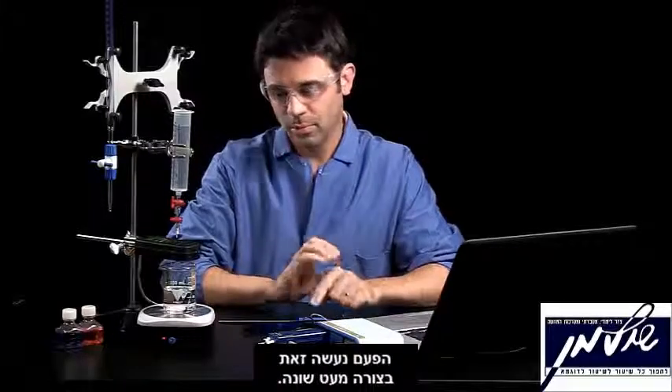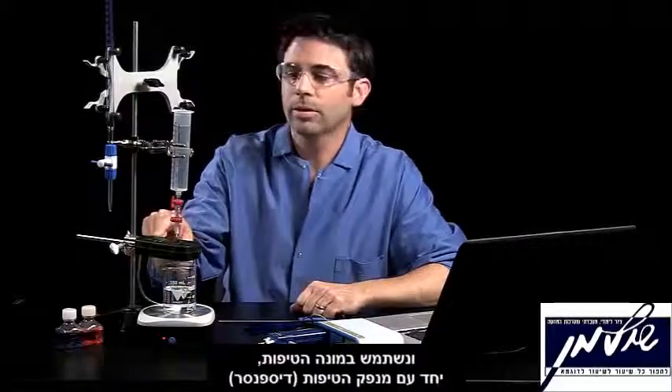In this case, we're going to do it a little differently. We're going to measure pH and temperature using our chemistry sensor, and we're going to use our drop counter and drop dispenser to measure the volume of titrant added. So let's get this set up so we can see how it works.